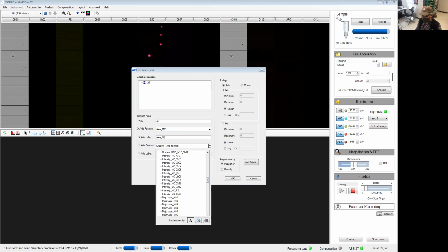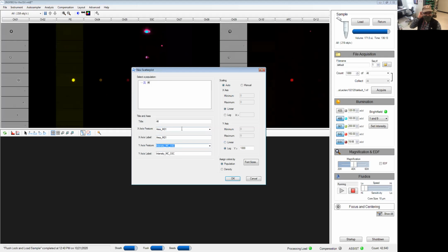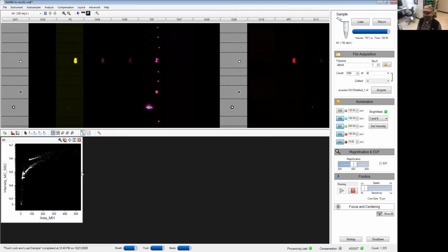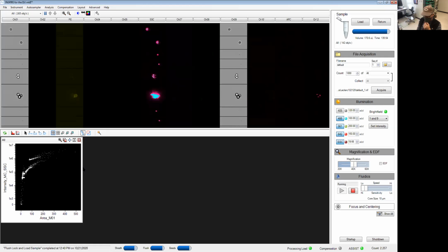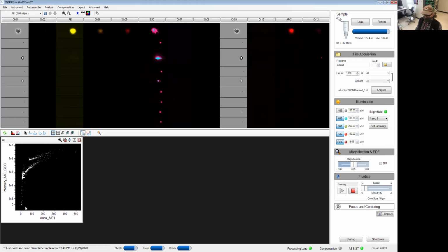So area will be my forward scatter, or the equivalent of forward scatter on a regular flow cytometer. The intensity is the equivalent of all these fluorescent channels that you're picking up on traditional flow. Because I'm a flow cytometry person, I like to start with that just because otherwise nothing makes sense to me. The axes are auto-scaling, meaning whatever shows up on the graph will actually change its scales to adapt to the size of the event. So as you get more and more data, eventually the scales get more stable and you can start working.